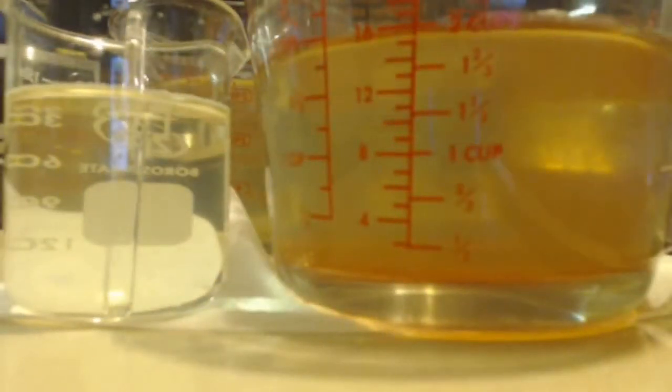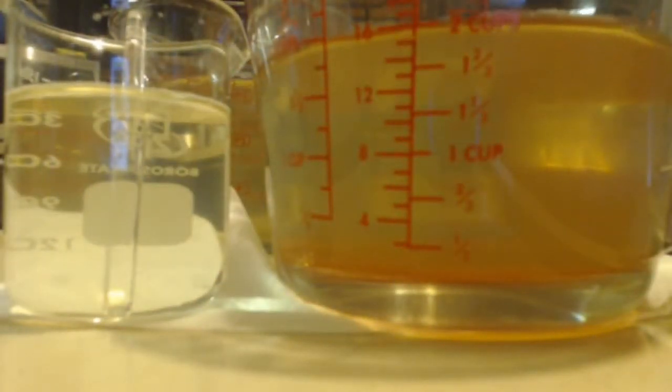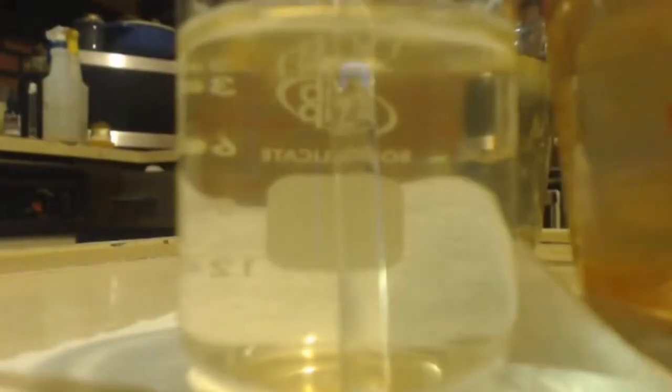So anyways, I've been trying to do the haloform reaction with this and make iodoform instead of chloroform. It's not working well. Either it comes out clear like that, or it just won't ever clear up like that. It doesn't matter what combination I use. Like start with the stuff that has a lot of crap in the bottom, like iodine and stuff, or I start with the stuff where I took all the iodine solids out. If I add more sodium hydroxide after, a little bit of both, it doesn't matter what I do. I cannot get it to work. So I'm going to call this a failure.